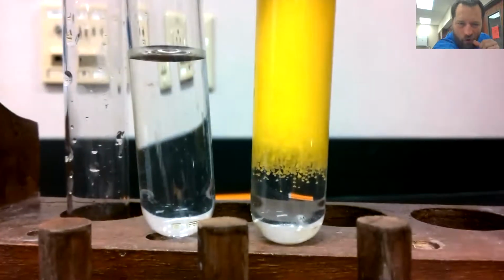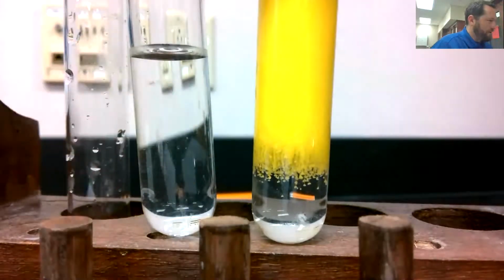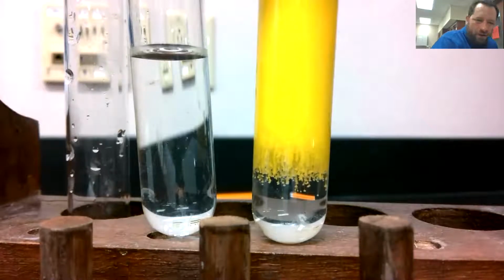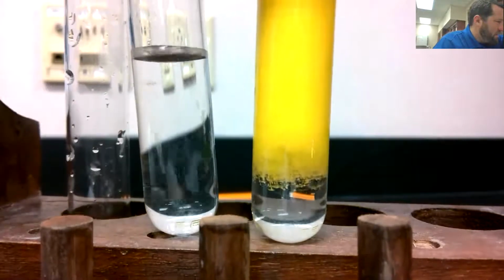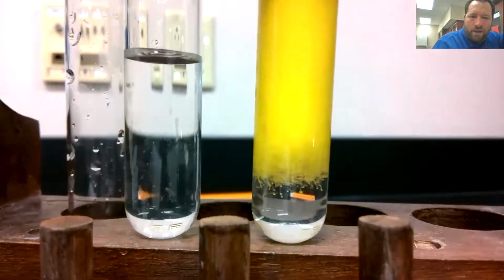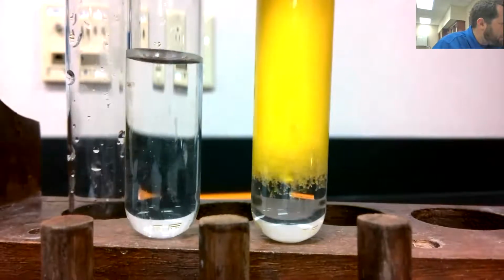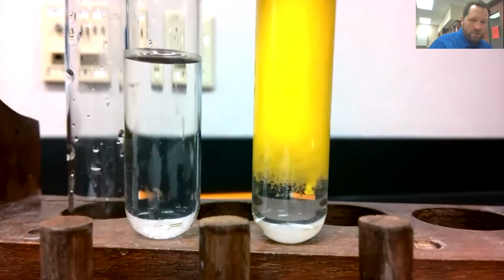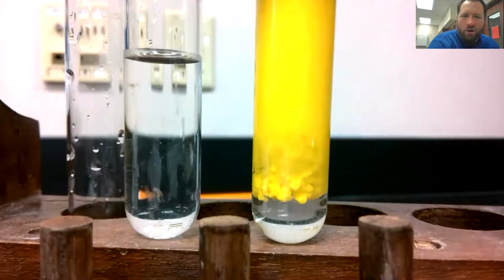Okay, so we obviously had one really big evidence of a chemical reaction. My goodness, we had two things that kind of looked like water. What do we have now? Would you drink that? Also, these yellow particles, they are indeed particles. It's almost like a salt came back. So it's almost like a suspended salt right there. We had those pieces of white crystal at the beginning, and now look at that. Hey, that's what we call a precipitate.